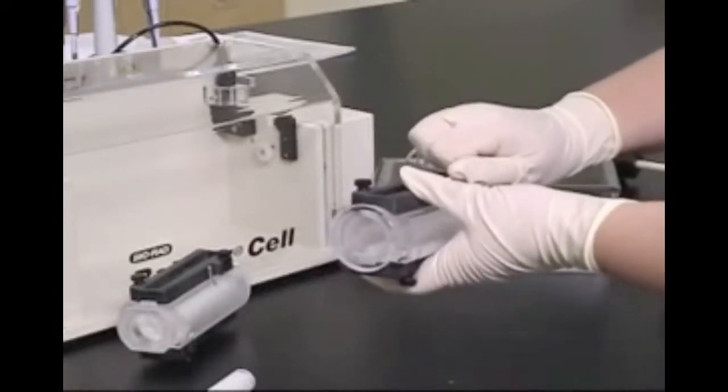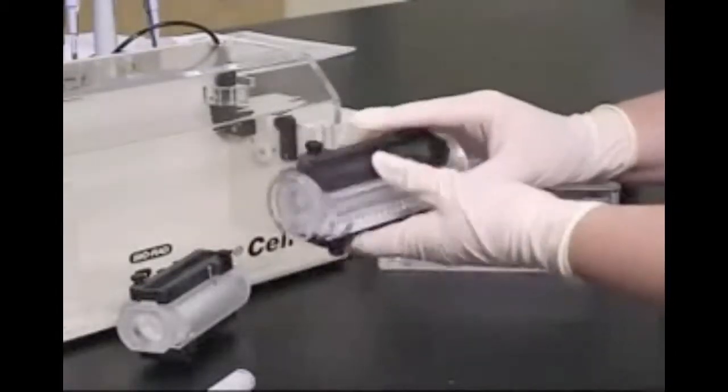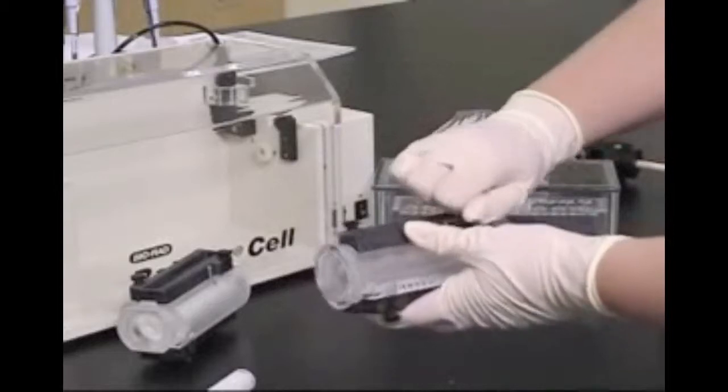The first step in preparing the focusing chamber is to remove these black plastic port covers and set them aside.